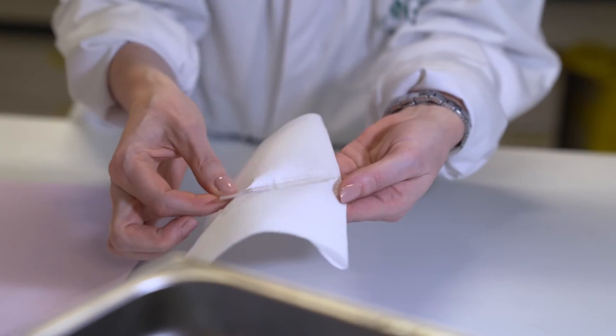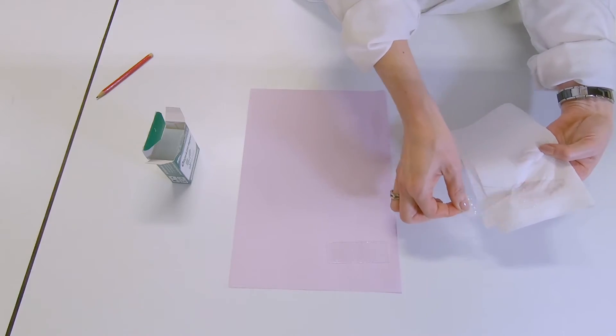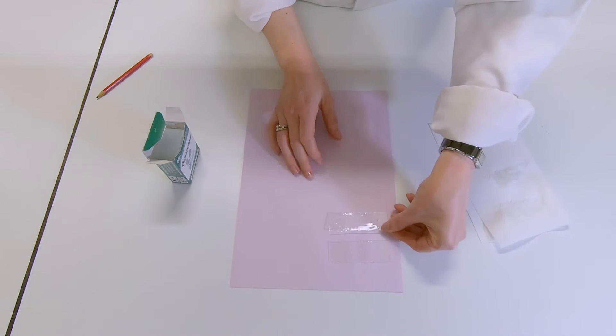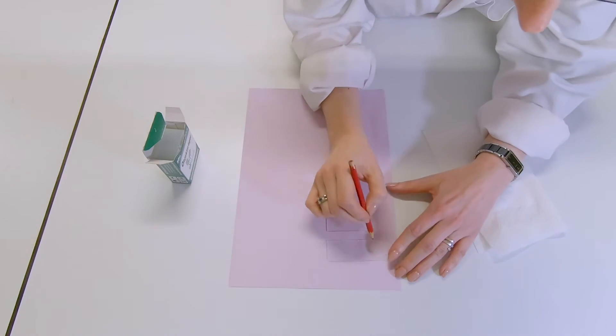Then you have to clean the back side of the slide with a wipe and leave it to dry overnight. Do not forget to label the pre-coat side of the slides.